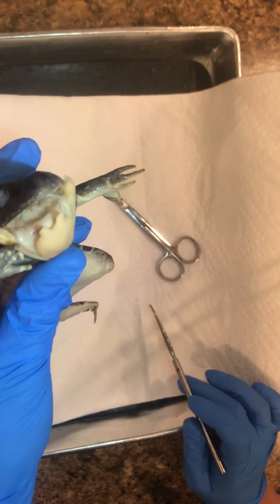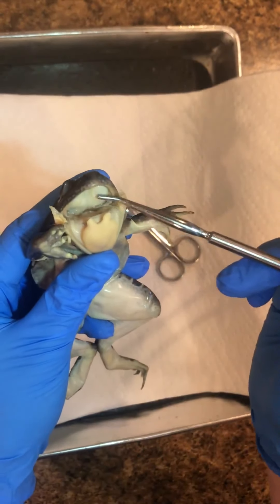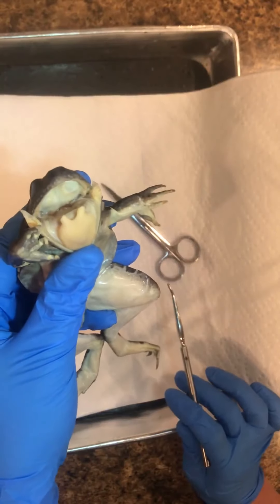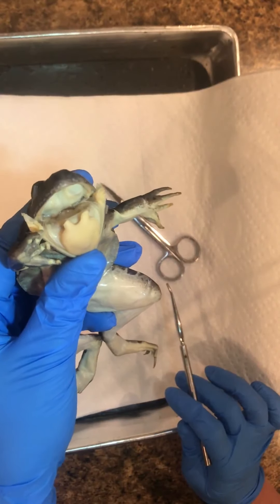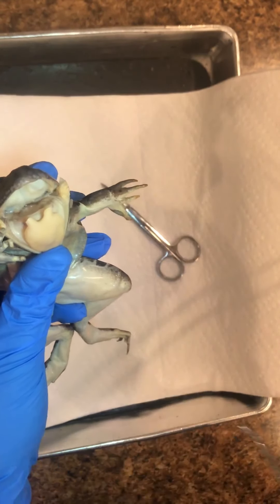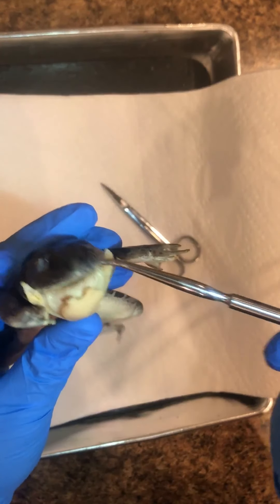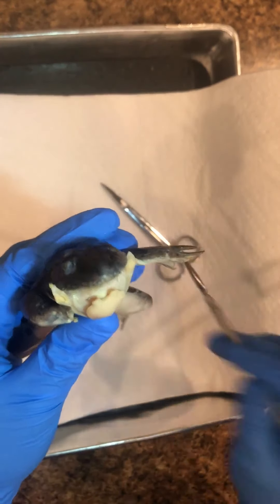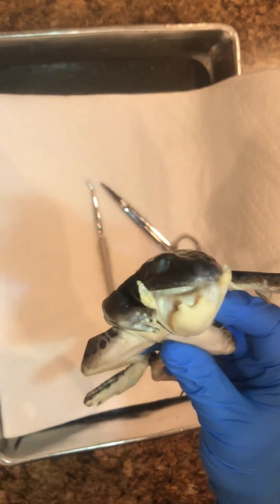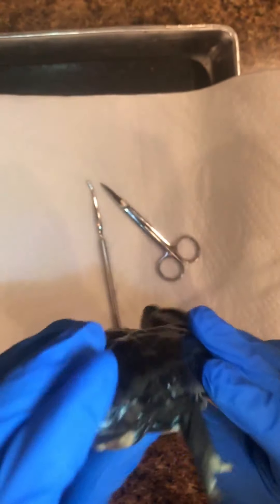Here's something cool — the eyeballs actually help push food down the throat. They can be retracted through the skull and help push food down the esophagus. The teeth are mainly used to grip prey and keep it in place until the food is swallowed whole.